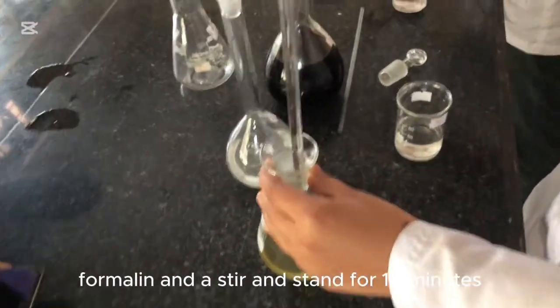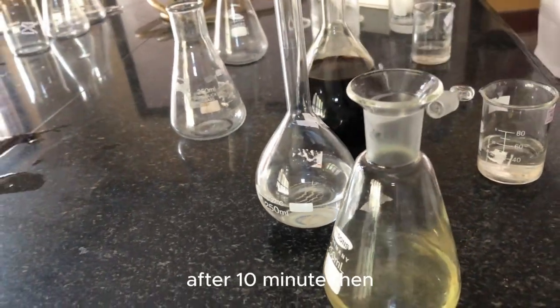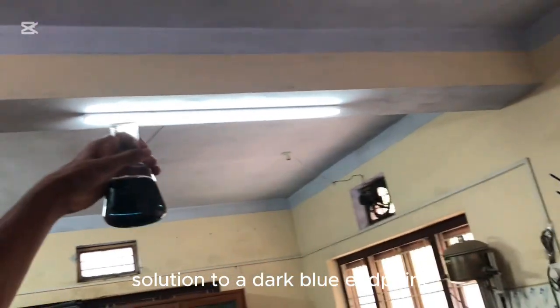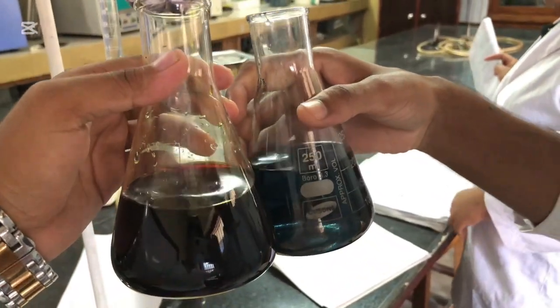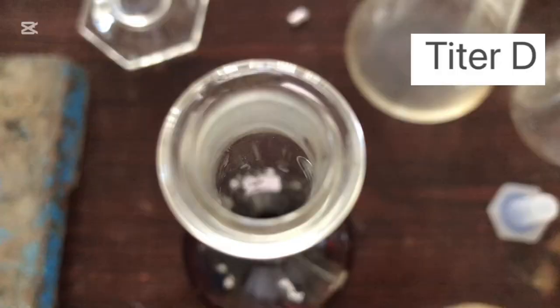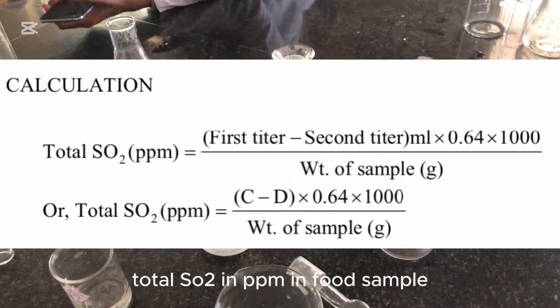Using the formula, we can determine total SO2 in ppm. To the other flask, add 10 ml formalin, stopper and stand for 10 minutes. After 10 minutes, add 1 ml starch indicator and titrate rapidly with iodine solution to a dark blue endpoint. Let the titer be D. Using the corresponding formula, we can determine total SO2 in ppm in the food sample.